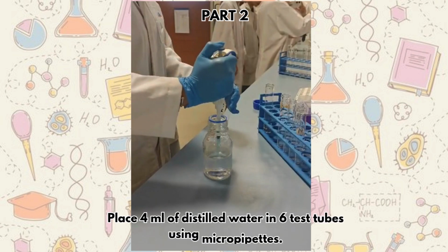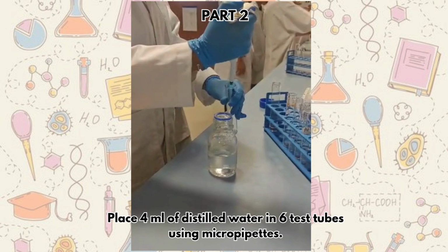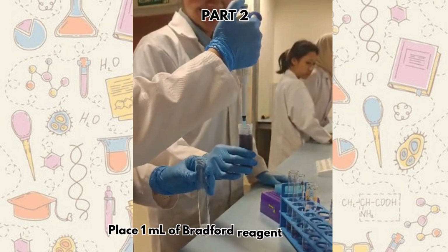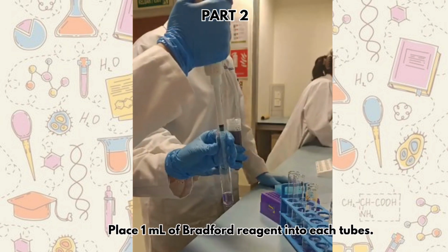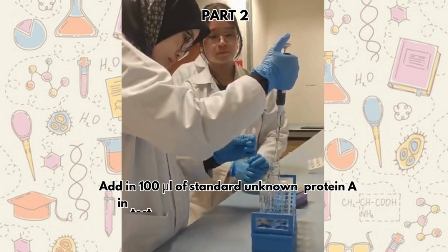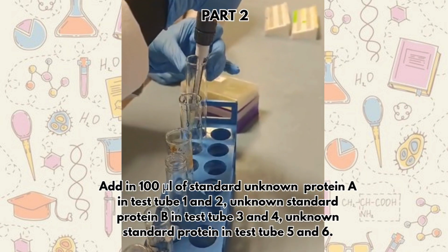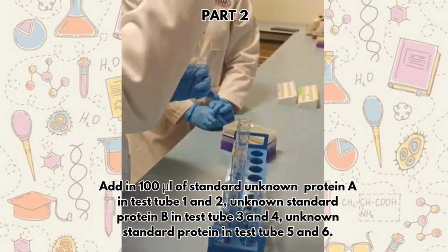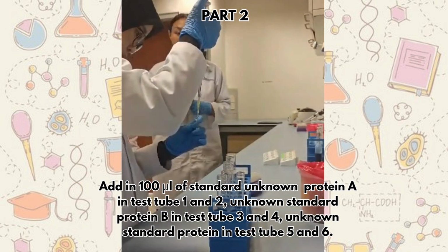Part 2. Place 4 ml of distilled water in 6 test tubes using micropipettes. Place 1 ml of Bradford reagent into each tube. Add 100 microliters of standard unknown protein A in test tubes 1 and 2, unknown standard protein B in test tubes 3 and 4, and unknown standard protein C in test tubes 5 and 6.